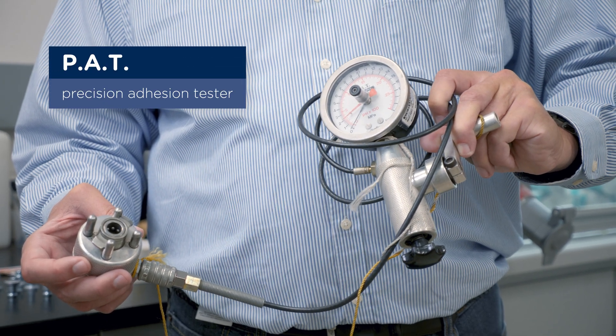Hi, I'm Leonard Phelps and I'm a chemist here at the Janney Technical Center. Today I'm here to talk to you about adhesion testing. There are many different types of adhesion tests, and today I'm going to be talking specifically about pull-off adhesion testing done with the PAT Handy Tester.